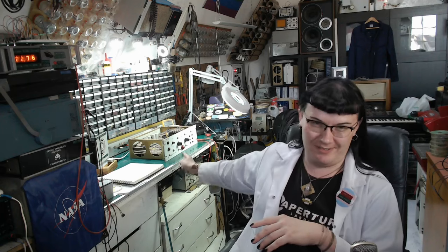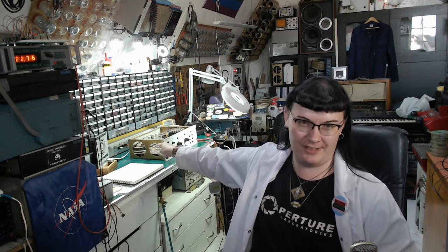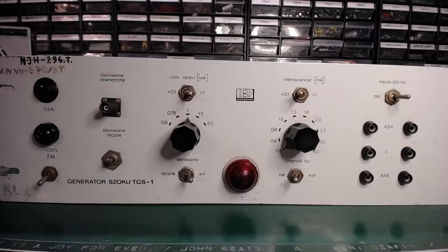What is this? This is the TGS-1 shock generator used in an experimental setup with a Skinner box. We're going into some ethically questionable science here, and I will tell you how this thing works, because I reverse engineered it. So, let's take a look at the front panel first.